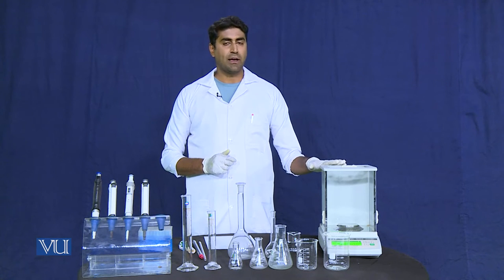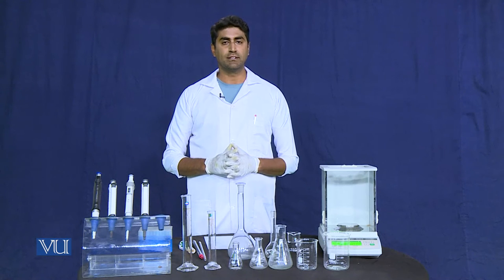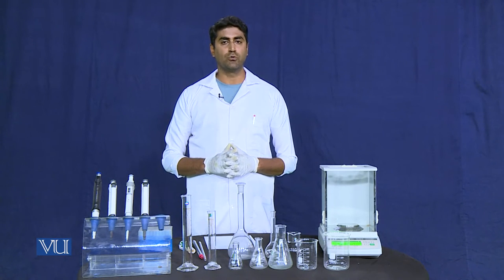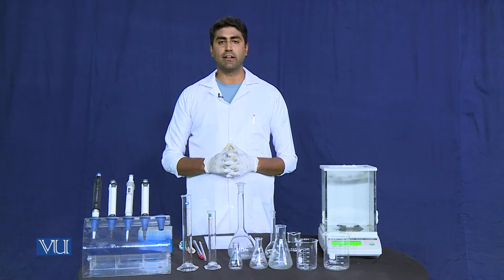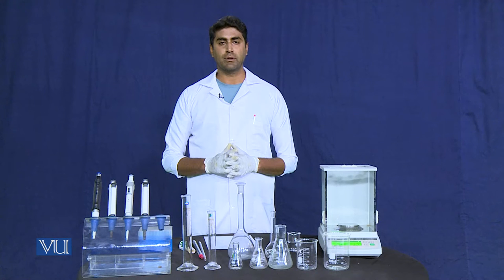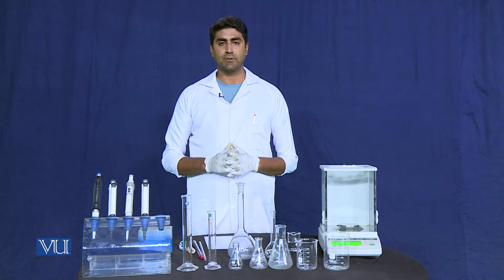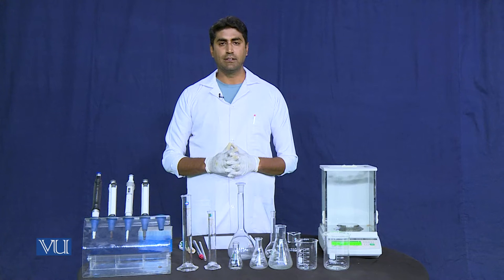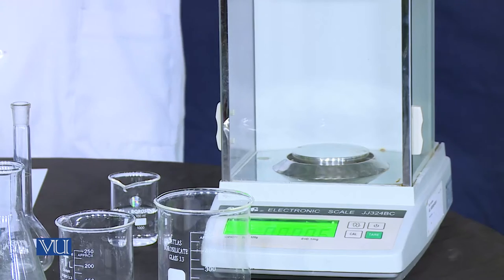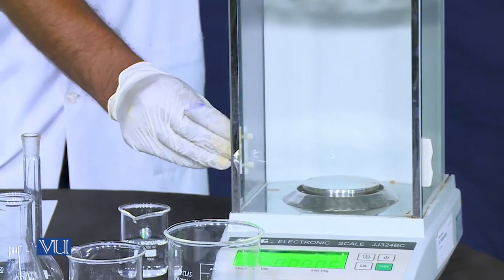Weighing balance is an instrument that is used to measure the mass. They are of two types: analytical balance and precision balance. Both of them can be different as per quantity and precision. If we look at this weighing balance, it has three different windows.